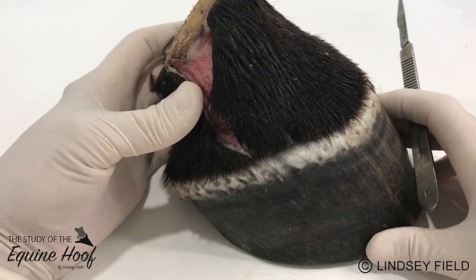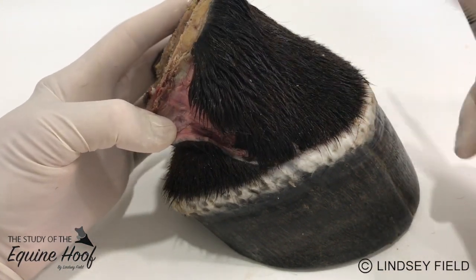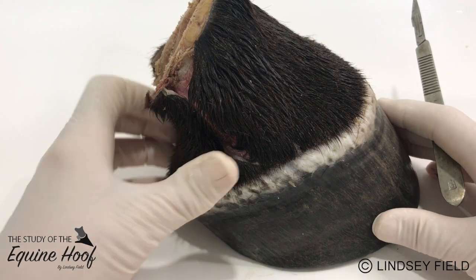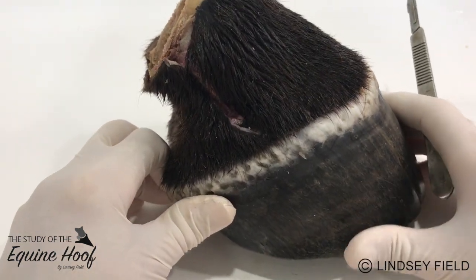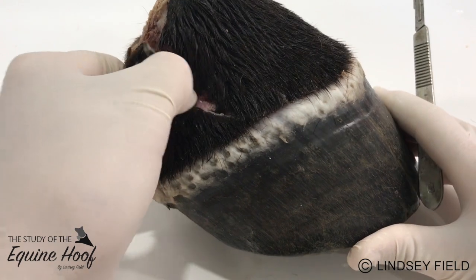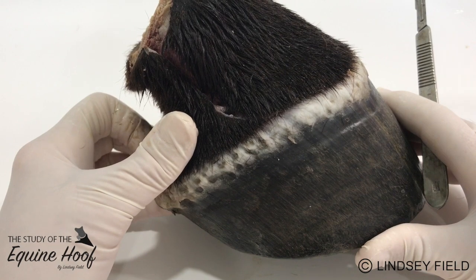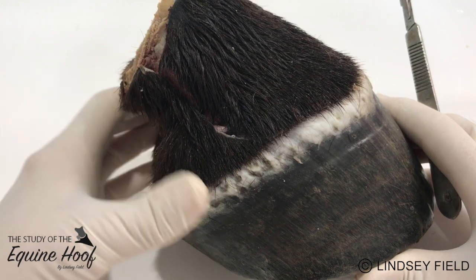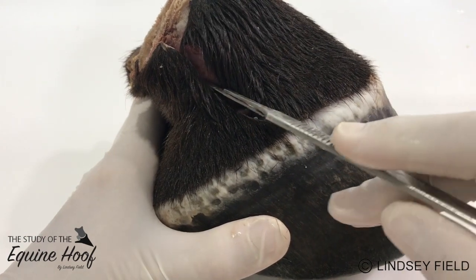This is a horse hoof dissection and today I'm doing something quite different. I'm going to take the hide off and video that process, looking at all the structures at the top. The whole purpose is to get to the capsule and the bones in the foot because I want to preserve just the bones and the capsule. I thought it would be a really good opportunity to video the process so we can look at the structures inside together.